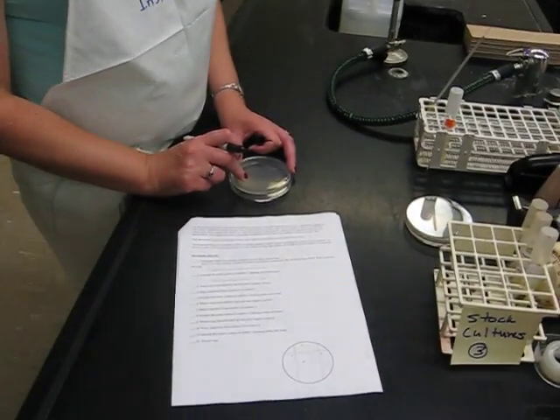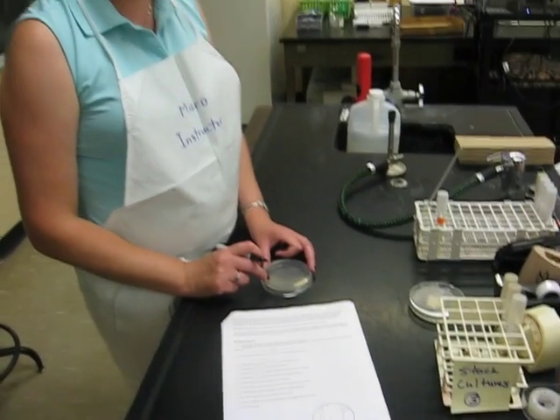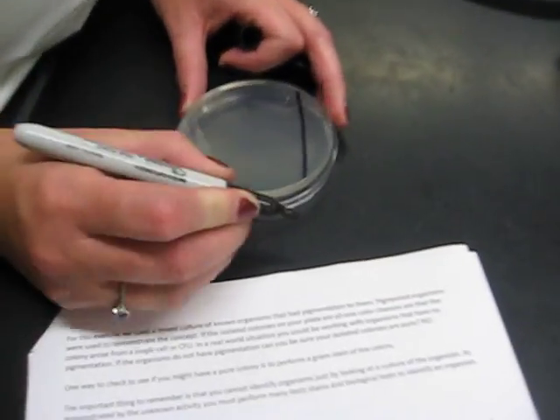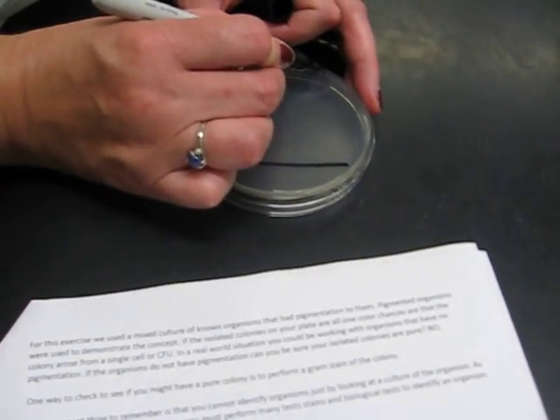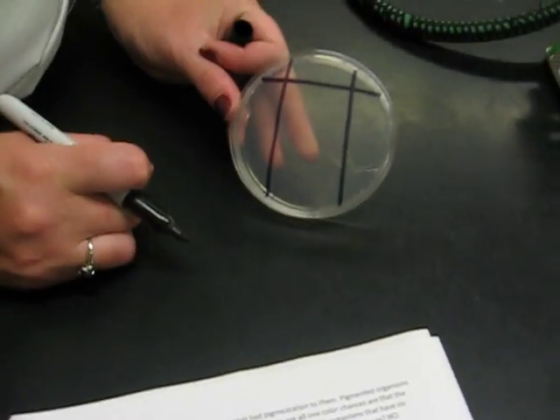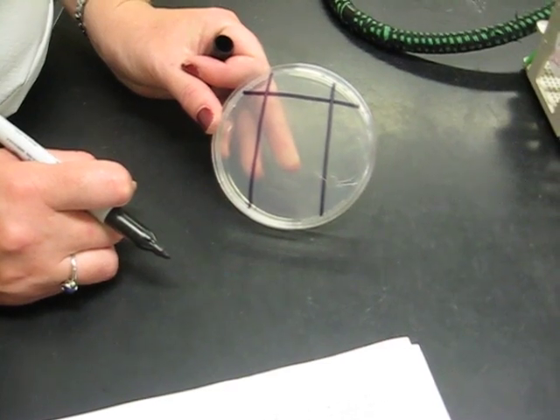I draw on the bottom of the plate because that's where the food is, that's where the bacteria is going to grow. So I'm going to draw a line across the top on one side and on the other side. It almost looks like a hockey goal, a goal post.